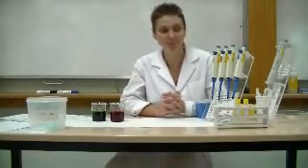Hi everyone, this is a revision video of the correct use of micropipettes. You will have already used micropipettes in your first year classes, but they're something that you will use throughout your degree, so it's really important that you know how to use them correctly.